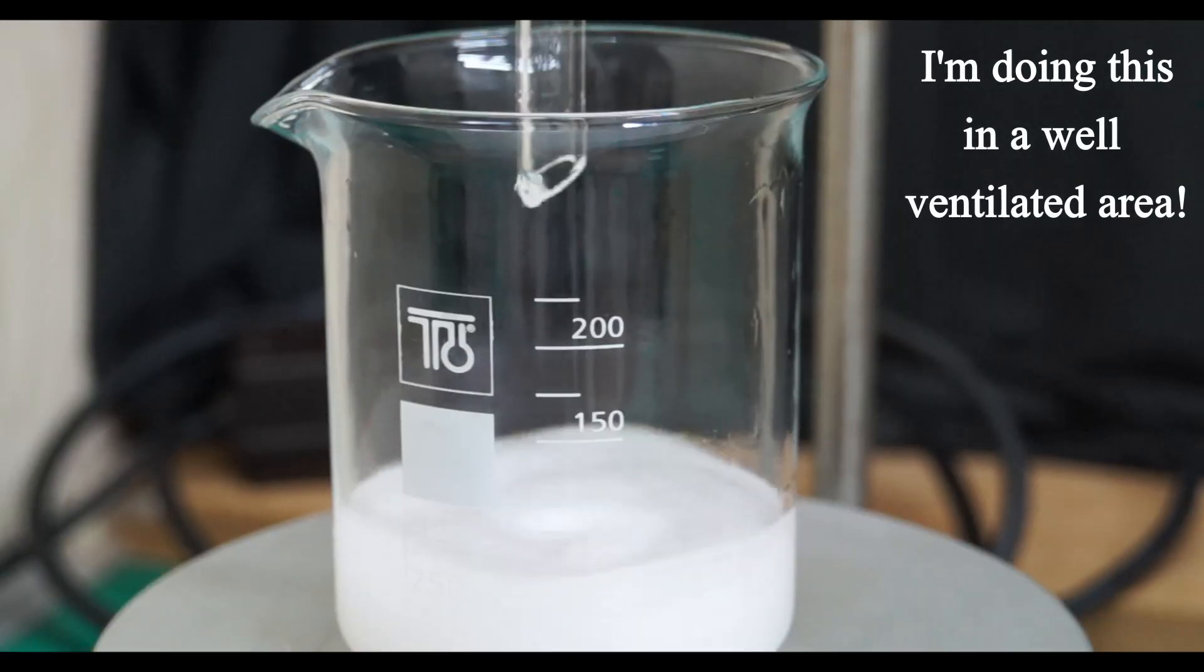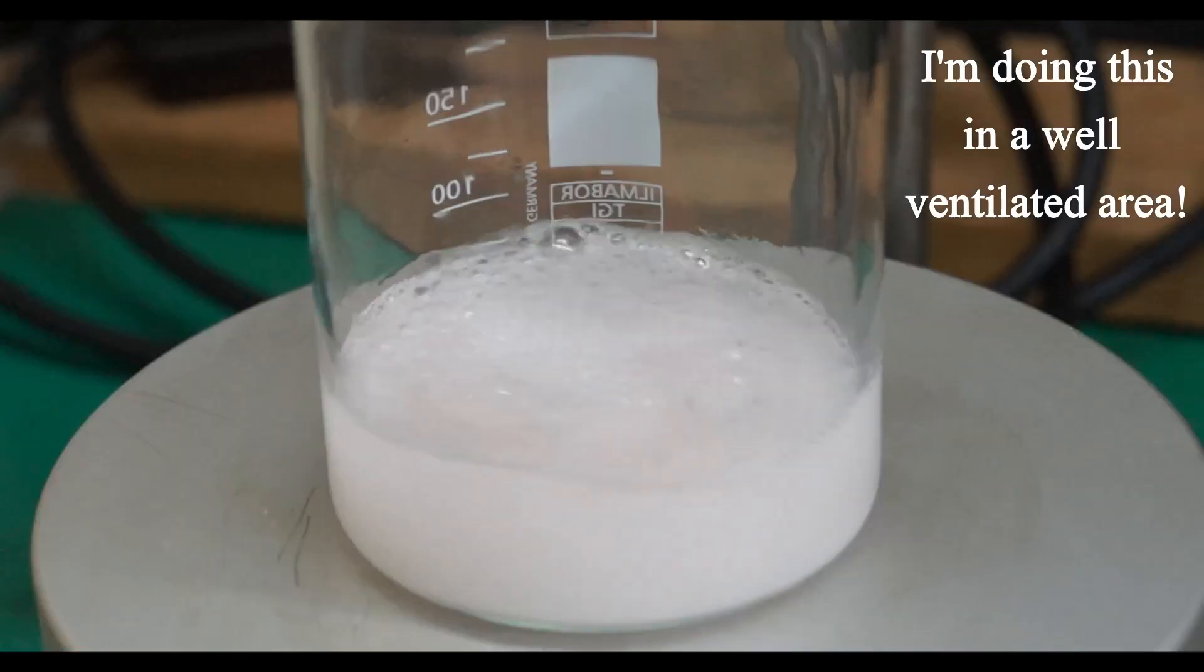The evaporation proceeded quickly and even before I finished this second filtration the product was already crystallizing in the beaker. After all the solution was filtered I washed the vacuum flask and the funnel with an additional 30ml of fresh hot acetone.